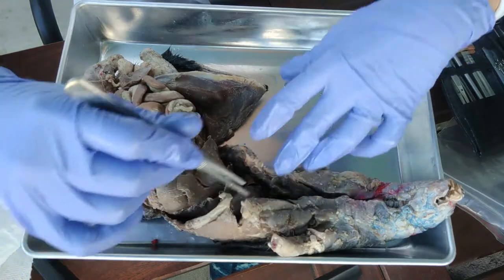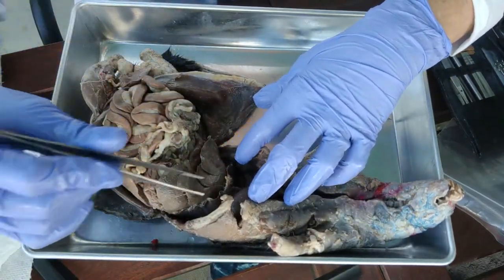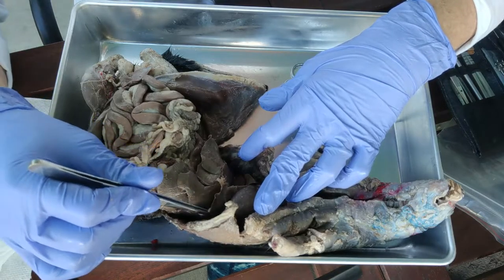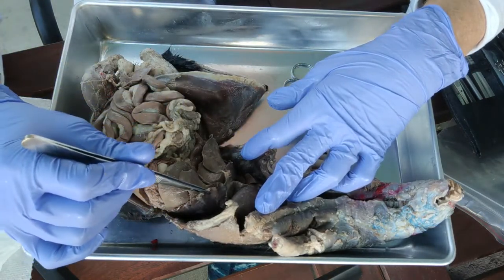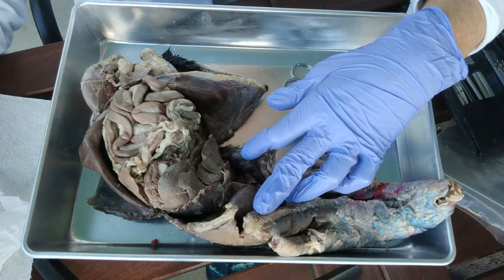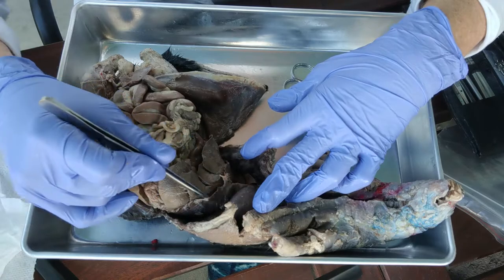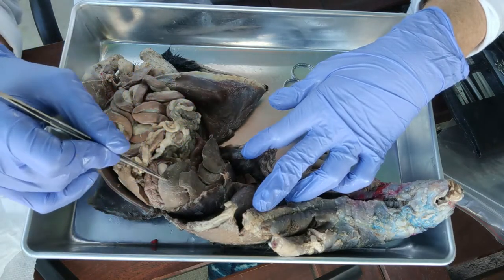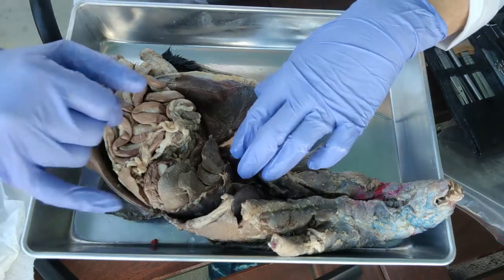Here is the thoracic cavity and this is the abdominal pelvic cavity. The structure that divides the two cavities is the diaphragm. We already looked at the diaphragm with the respiratory system, but just underneath the diaphragm is this very large internal organ — this is the liver.